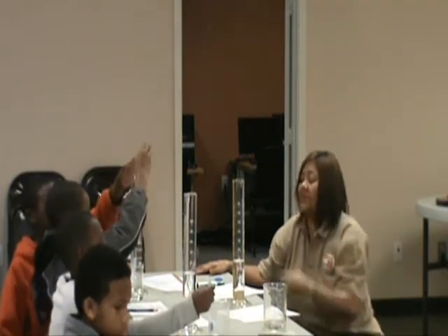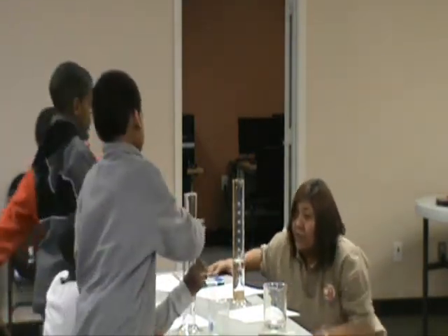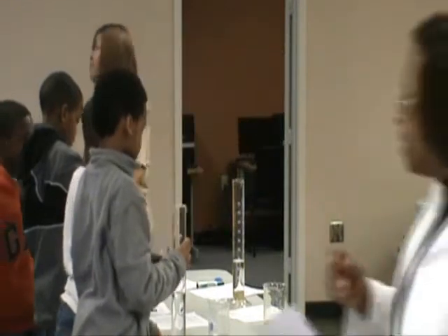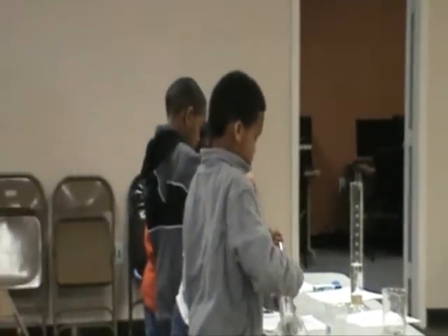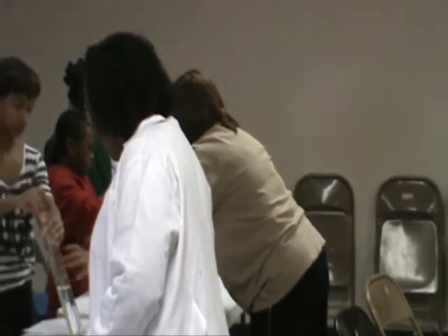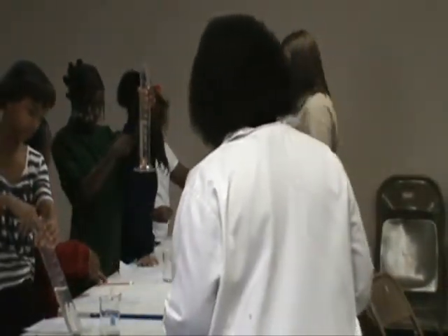Okay, at this time, stand up, back up, and slowly release. Look at what you're doing. Don't pay attention to us. Look at your flask. Work together. Slowly release. Tilt it slow. Yeah, that's good. You can pull the flask back. You can tilt it slow. It's going. Okay, now let it go real slow. That's okay, you're all right. Now get your air bubbles out.